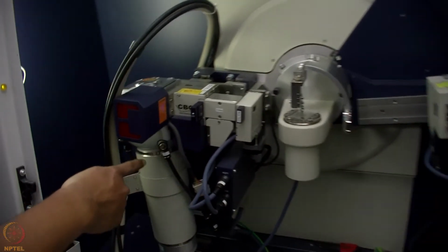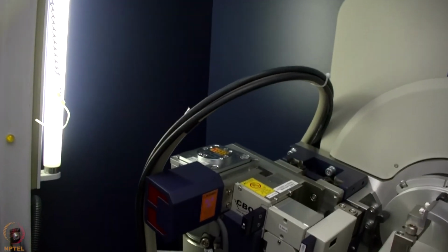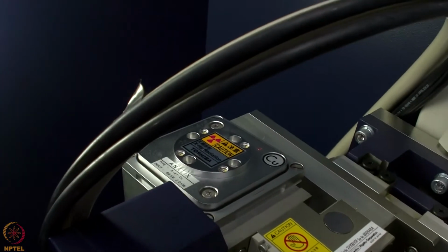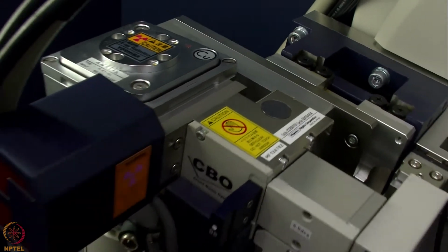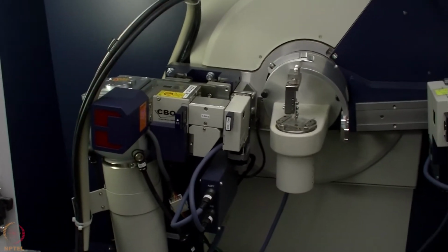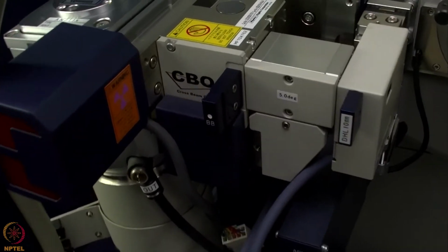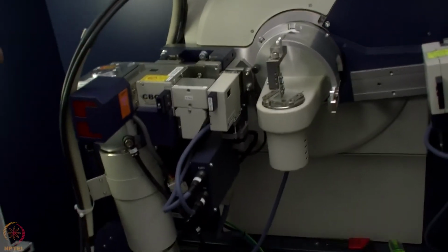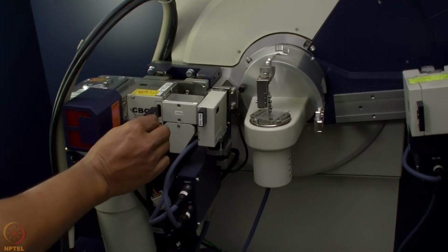On the left hand side here, we have the X-ray tube mounted. This is mounted from the top, and you can probably see that this is a copper based X-ray source, which is written here as copper. So the tube is giving you copper K alpha and K beta radiation. When the beam comes out, this is the optics, which is called the cross beam optics. It then makes the beam in a linear fashion, and then we have some slits here.